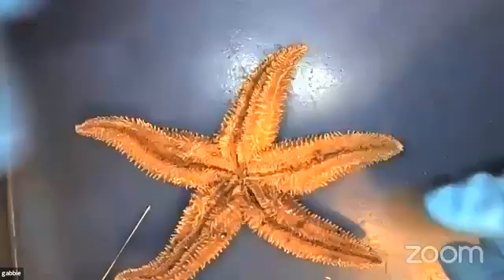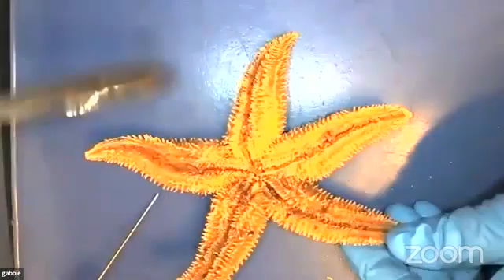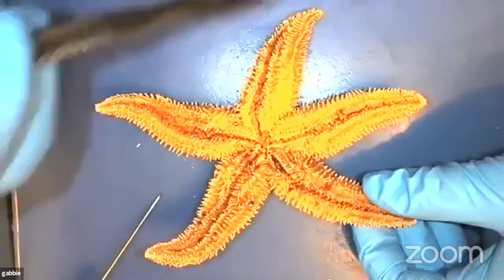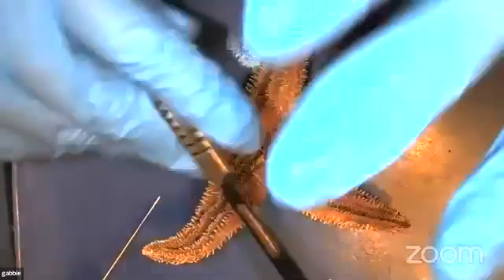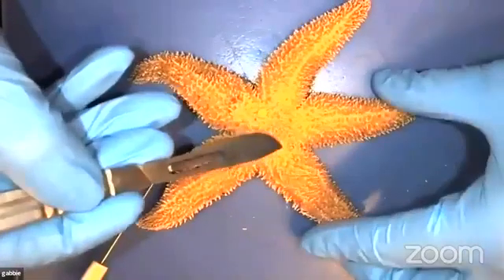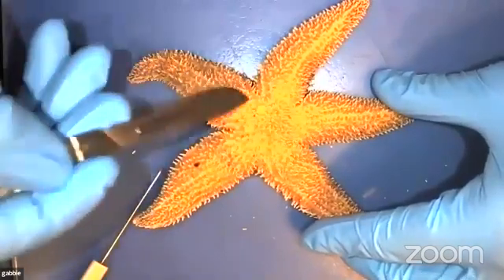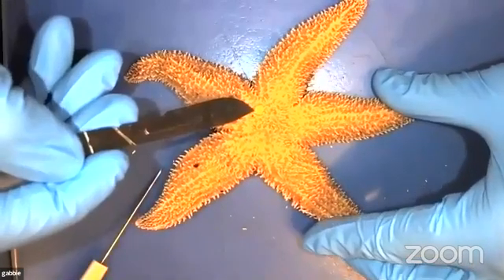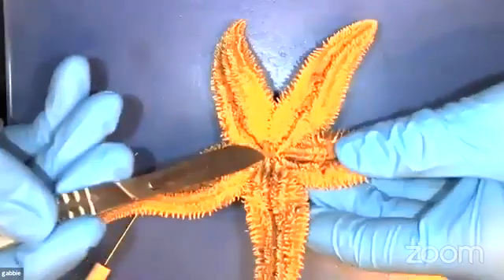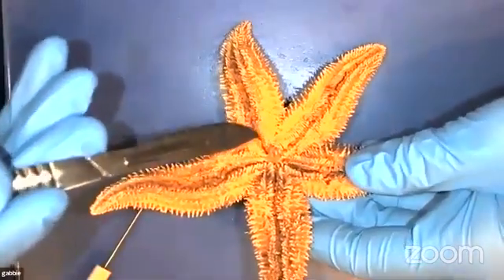They also have something called eye spots that are on the ends of their appendages. This is kind of like eyes, but they can't quite see as well as we can. They can just see general light changes. And so they do have a general sense of direction. Right in the middle of the sea star, they have something called a central disc, which also holds the madreporite. And underneath this is their stomach. So they actually shoot their stomach out of their mouth to grab onto prey.